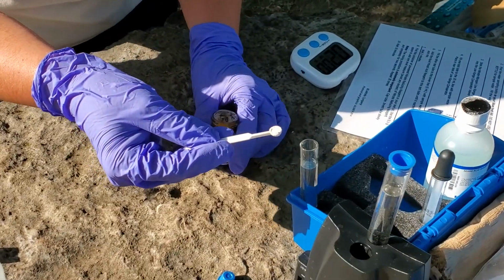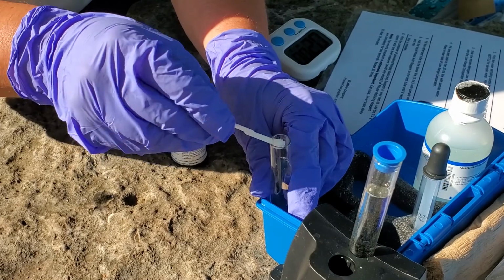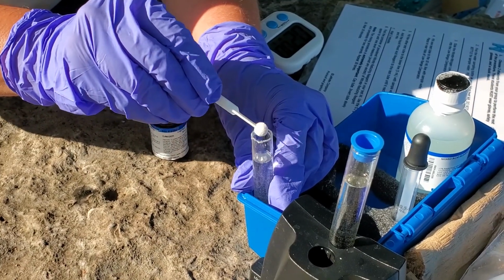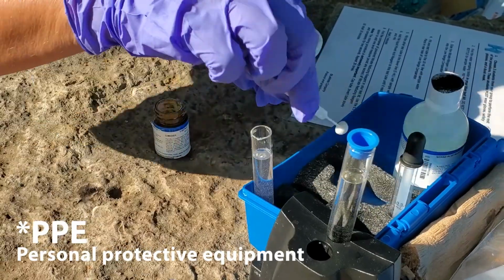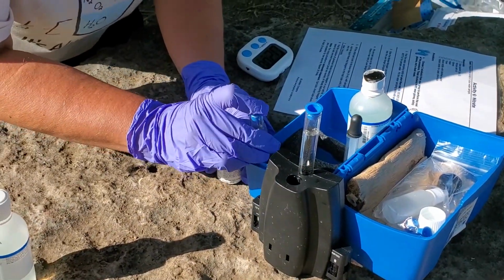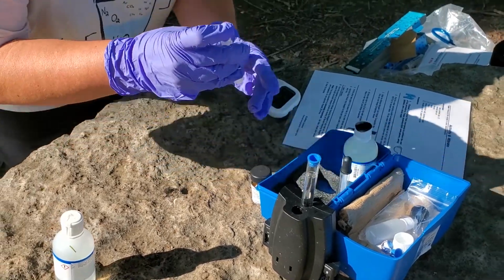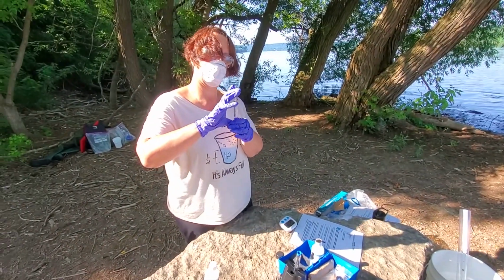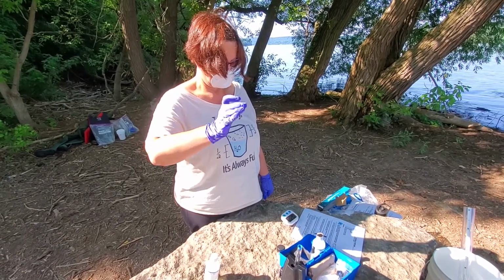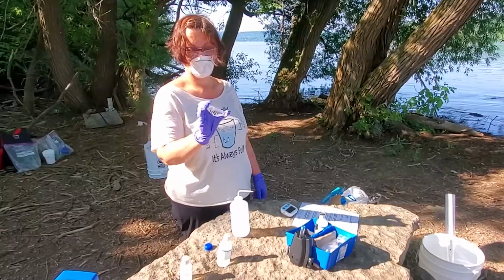Very carefully, because this stuff is one of the reasons why we have all the PPE. And now we mix. Okay, I'm going to turn this up and down like this 30 times.